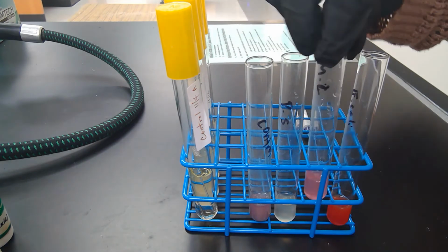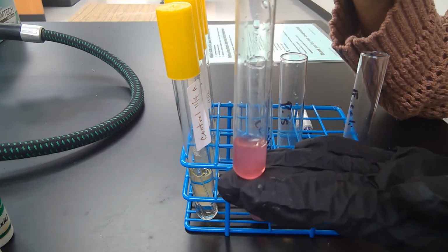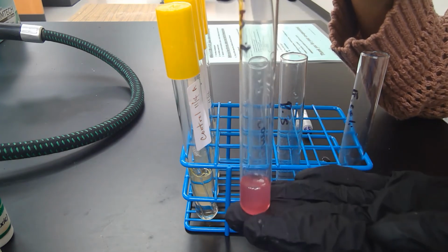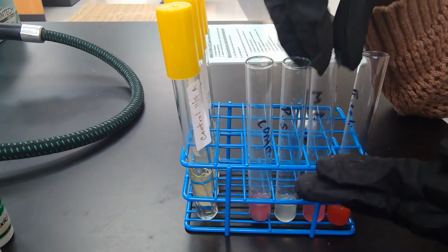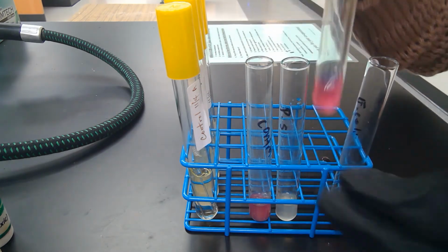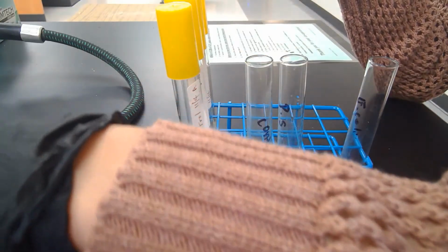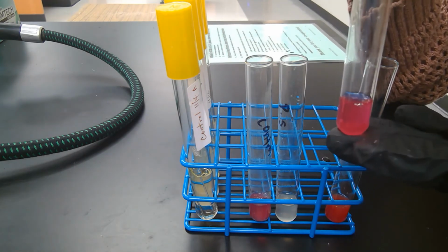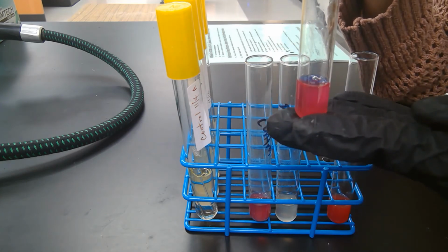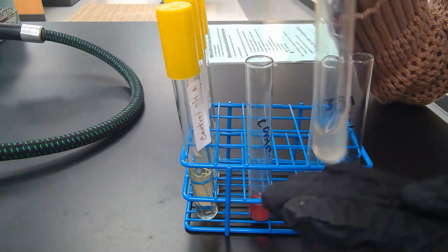The reason why Micrococcus luteus shows a pink or red color after the addition of zinc is because Micrococcus luteus is negative for nitrate reductase. So what happens when you add zinc? Zinc allows NO2 to be formed from the NO3. That way reagent A and B will cause a red color, but only after the addition of zinc. And that means that there was still NO3 in this tube because Micrococcus luteus did not have the enzyme to change NO3 into NO2.